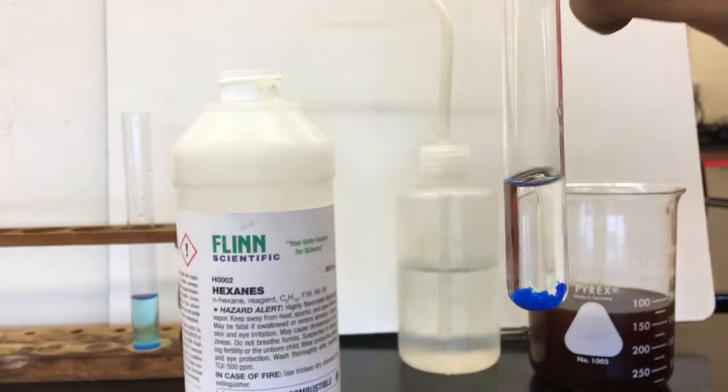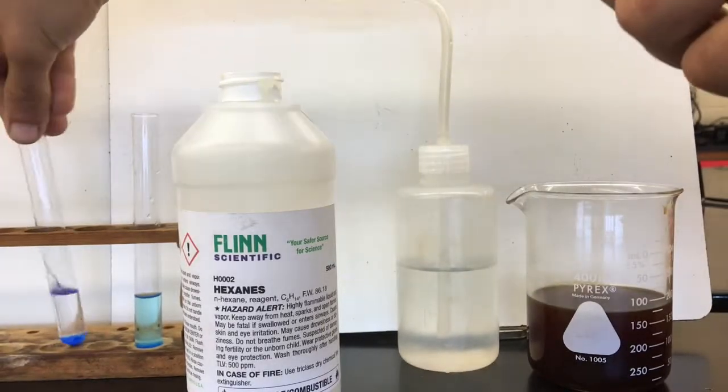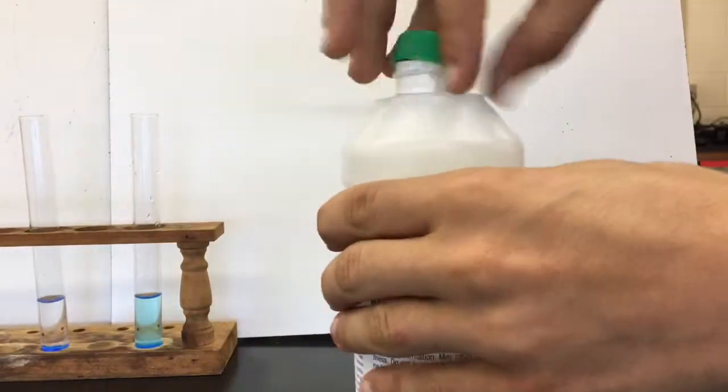Hey, let's put the cap on. You know what I'll do is I'll put down my test tube first. That'll make that much easier. Screw our cap back on.